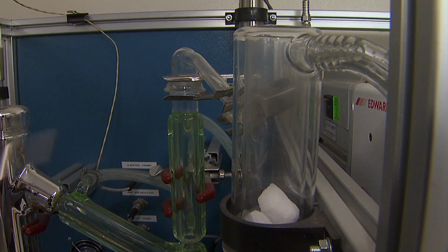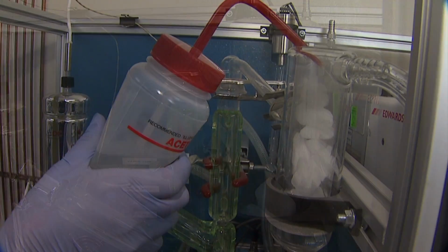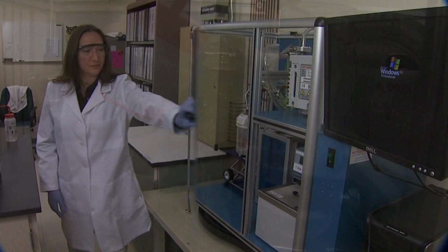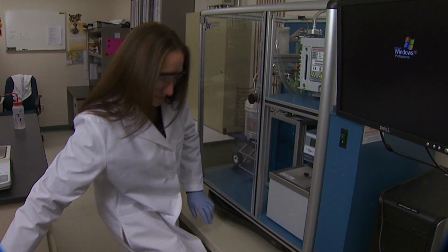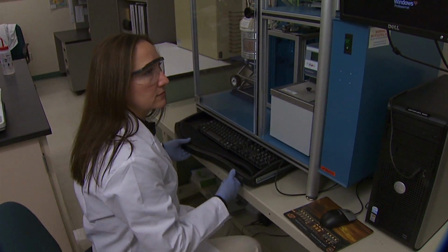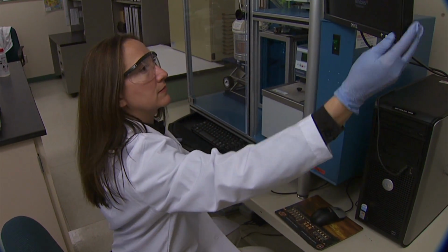Fill the cold trap with small pieces of dry ice, then add acetone to approximately 2/3 full. This step is merely a safety precaution to isolate volatiles that might be present in the sample and should not be used to quantify the low end of the distillation.